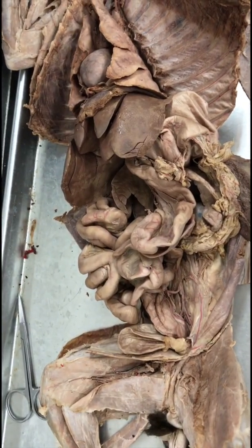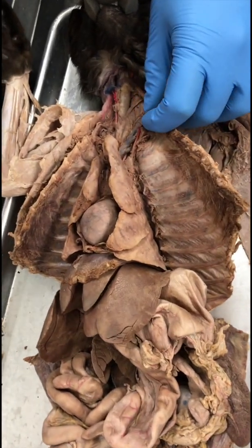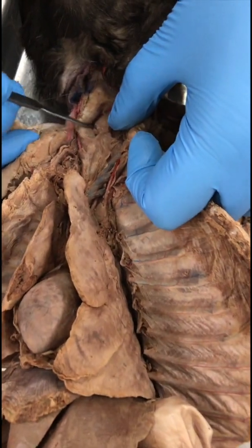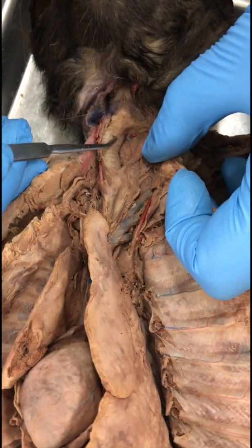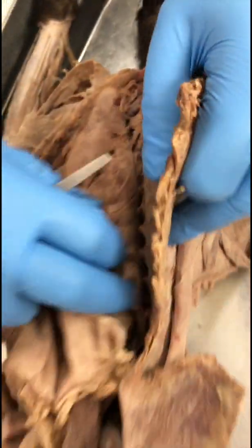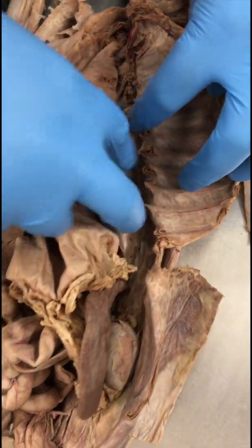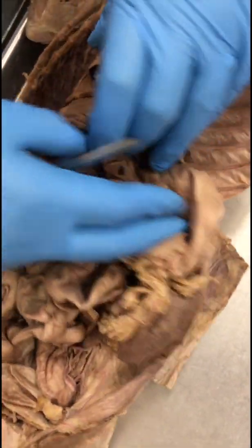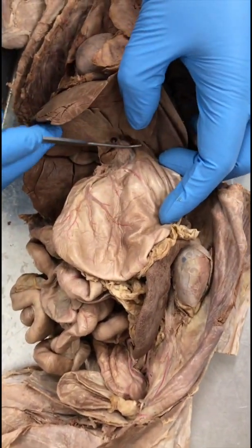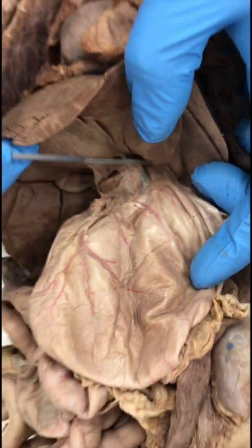Esophagus. So that's the food pipe. You can see it at multiple places. Here you can clearly see the food pipe. It's like a muscular structure behind the trachea. Sometimes you'll be able to see it near the dorsal aorta in this region, depending upon the cat. This part that goes into the stomach is also the esophagus, the food pipe. This one right here.